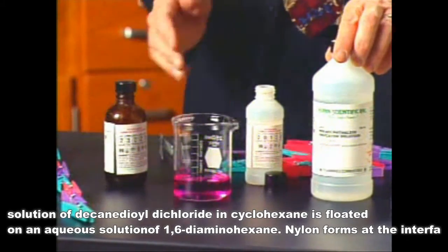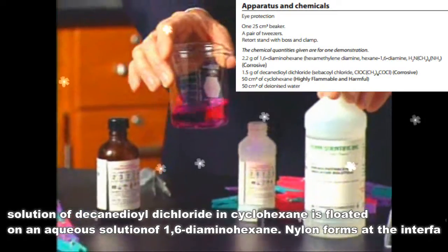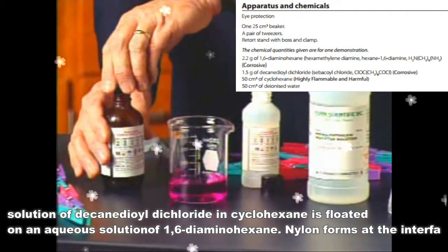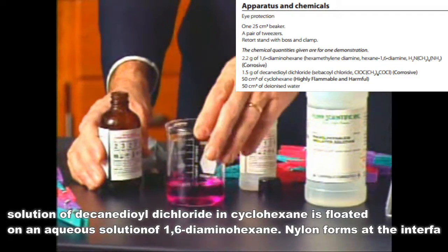Here to this chemical we're adding a few drops of phenolphthalein indicator. It's basic and therefore the color will allow you to see this layer.